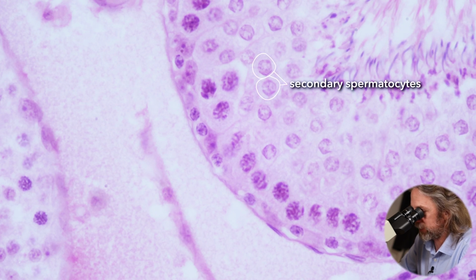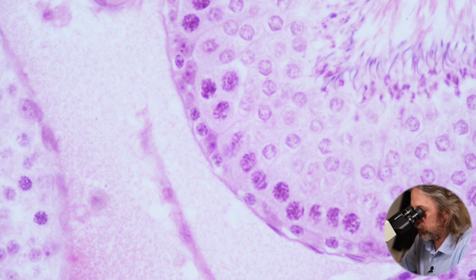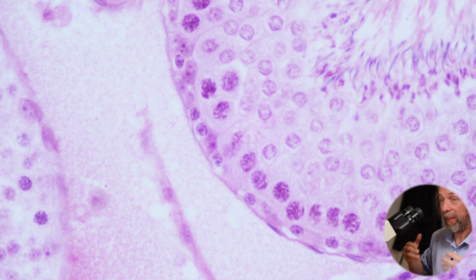So if you look at those secondary spermatocytes, we can again see that that dark purple is staining DNA, and we've got nice round circles, and that dark round circle, that's just us looking at the DNA, looking at the nucleus. If we look carefully, we can see the cytoplasm around the nucleus, and that's the rest of the secondary spermatocyte. Now, does it look like there's less DNA in the secondary spermatocyte than in the primary spermatocyte? Yes, it does. And that is what has happened in meiosis 1, the secondary spermatocytes have now only got one set of chromosomes each.